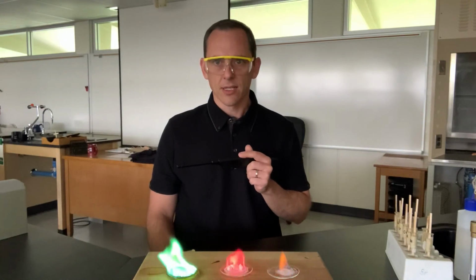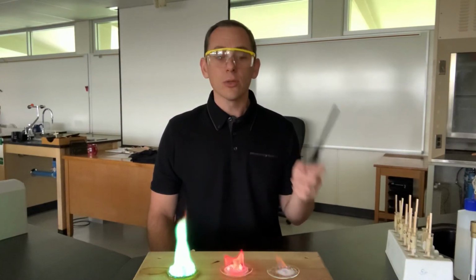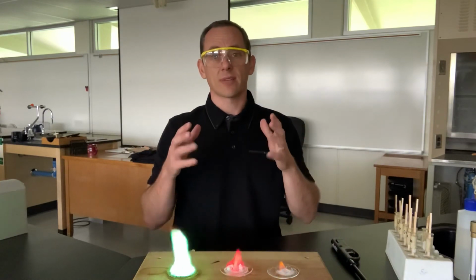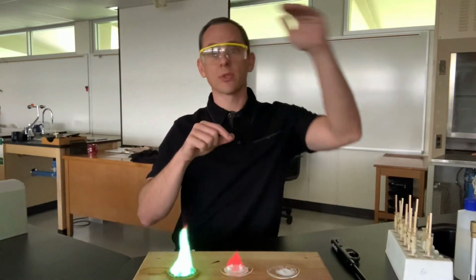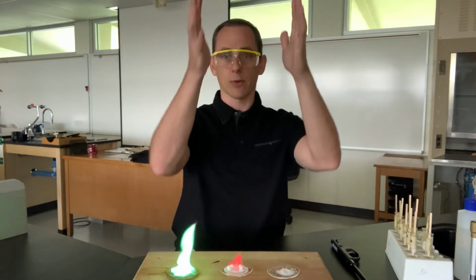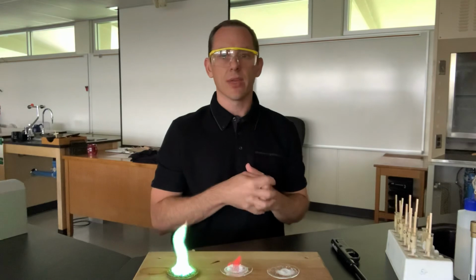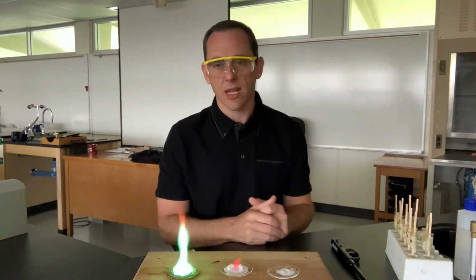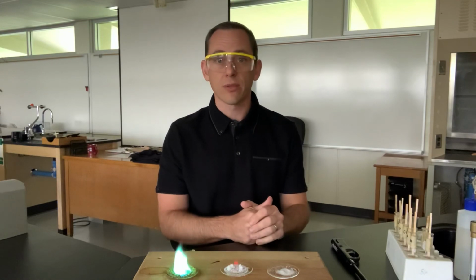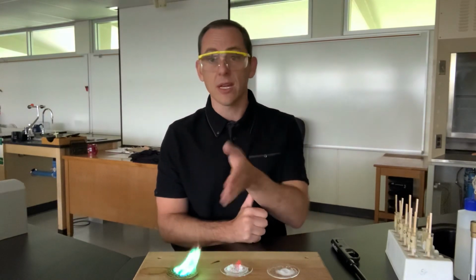Okay, so on the conclusion questions for the lab, you guys have to have some kind of table. Lithium was this color, strontium was this color, potassium was this color, right? All your recordings. And then you're going to have some questions to answer. One of the first questions is going to say there were 3.